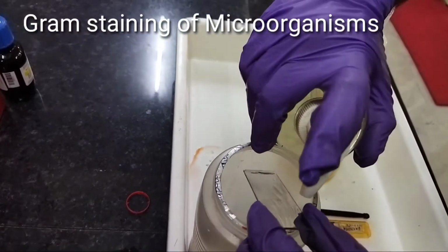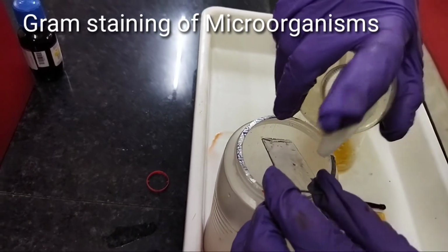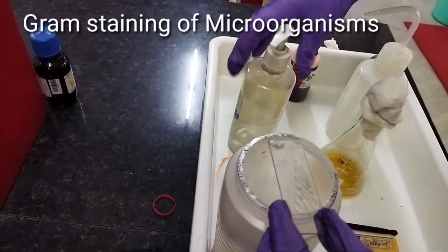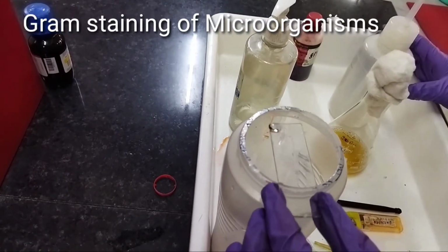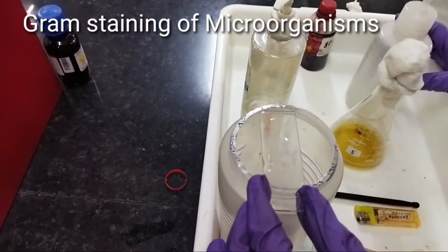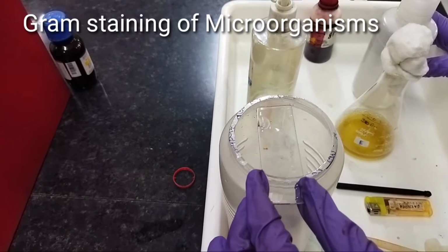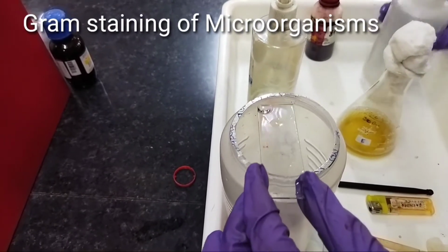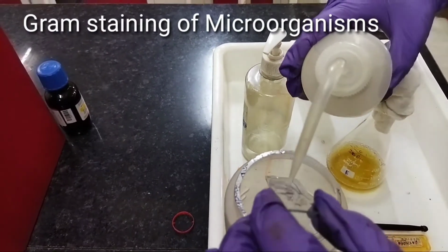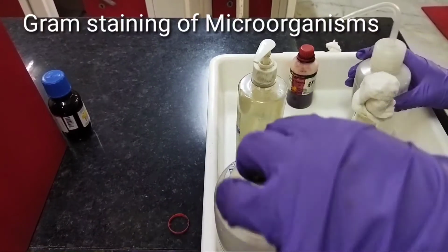After that we will wash the slide with 90% or 100% ethanol, and let the ethanol stay on the glass slide for 30 seconds. After that, wash the glass slide again with a gentle flow of distilled water.